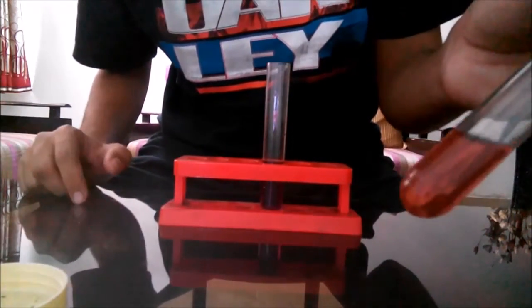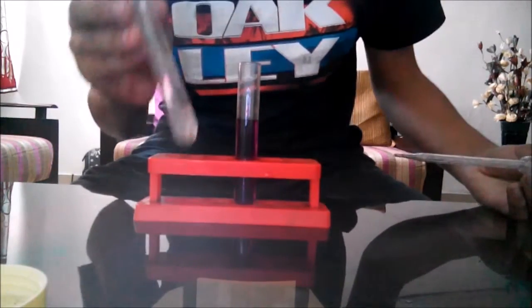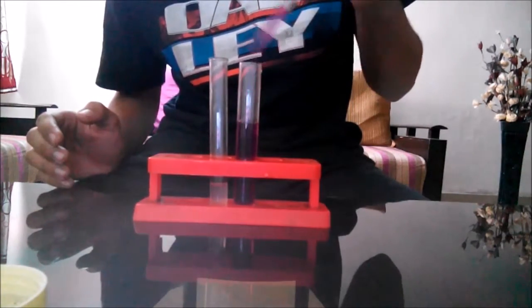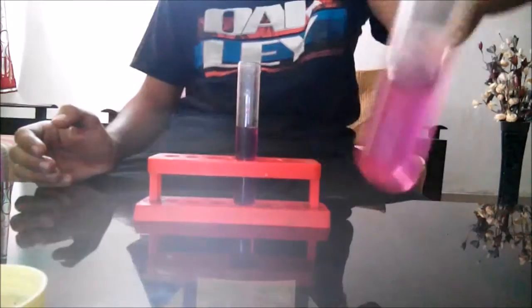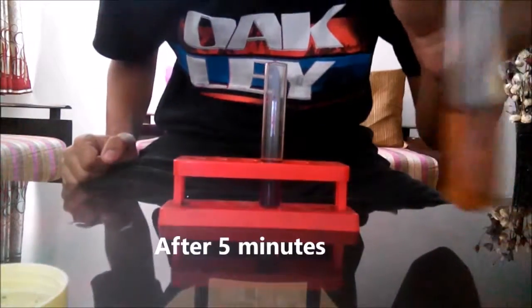Now here I have some glucose solution in this test tube. Again the reaction is quite mild, no apparent reaction seems to occur, but let's wait again.